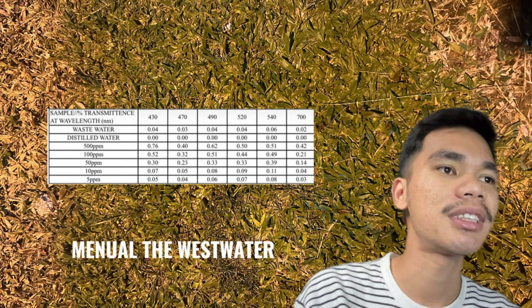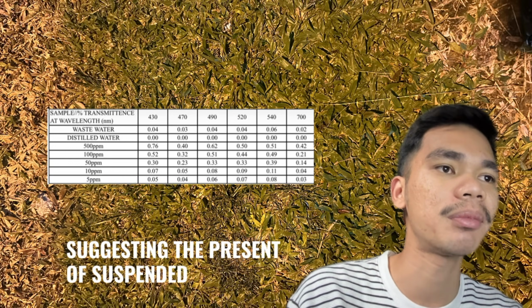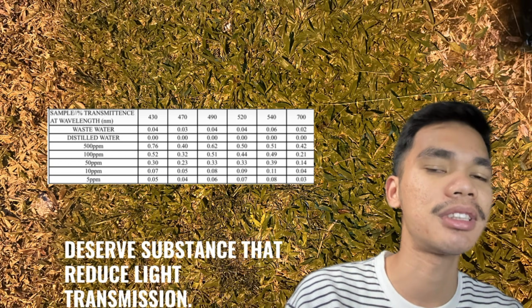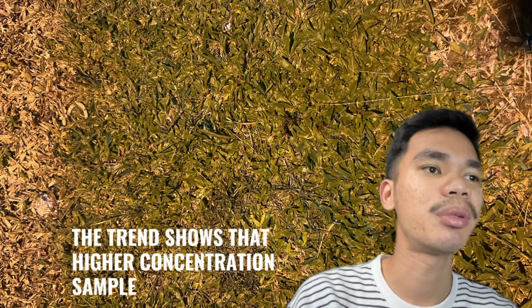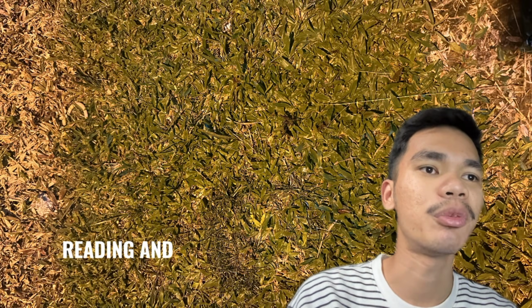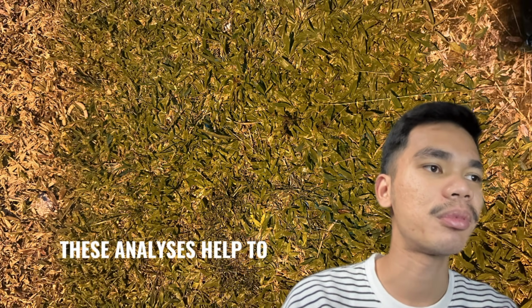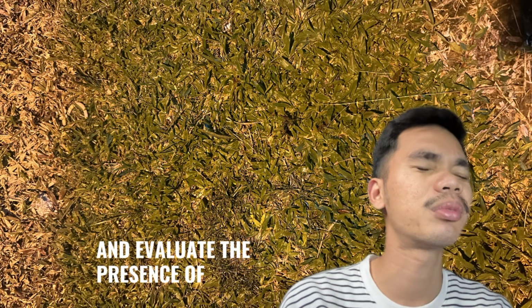Meanwhile, the wastewater sample shows very low transmittance values, suggesting the presence of suspended particles or dissolved substances that reduce light transmission. Overall, the trend showed that higher concentration samples produce higher transmittance readings, and wavelength change also affects the light transmission. This analysis helped to compare the optical properties of the samples and evaluate the presence of contaminants.